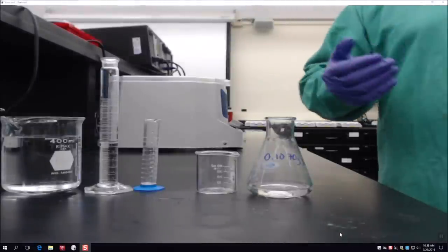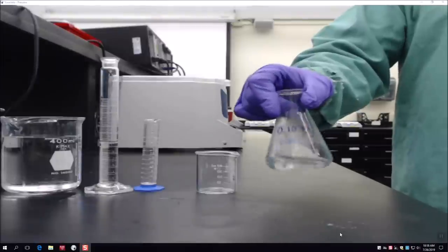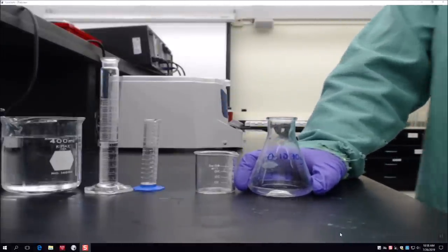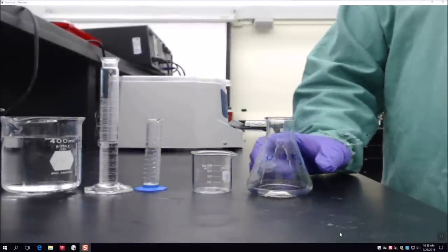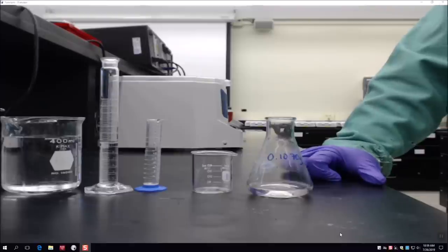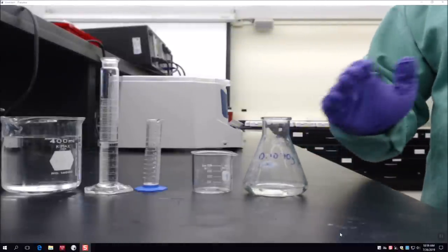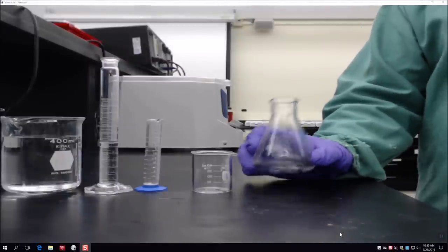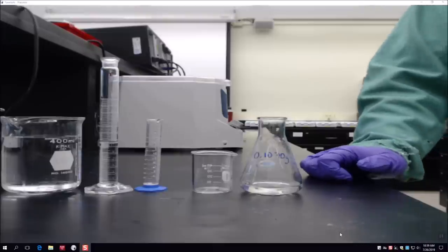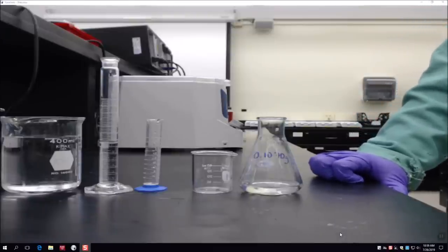Just like last time, if the expected result doesn't occur, test why using pH paper. If we still had magnesium hydroxide in solution and checked the pH and found it still basic, we would know we hadn't added enough sulfuric acid to neutralize all the NaOH, and we'd need to add more. But since we see no precipitate, we know we don't need to add more acid. Now we're ready to perform our final reaction, reacting magnesium sulfate with sodium carbonate solution.